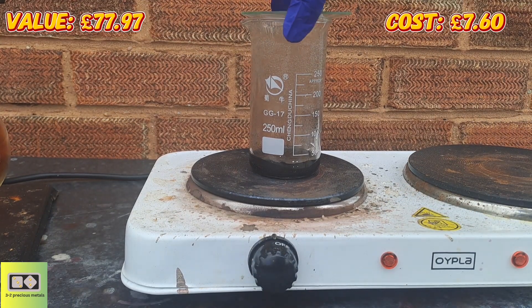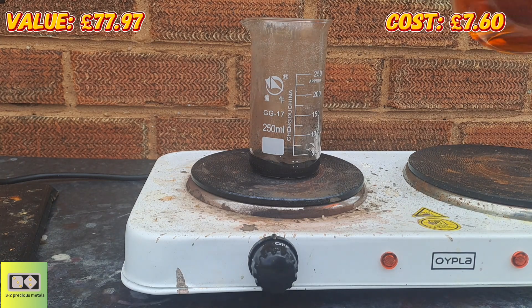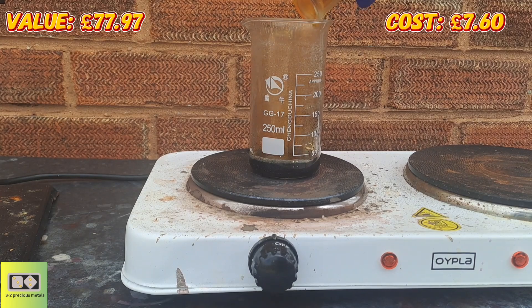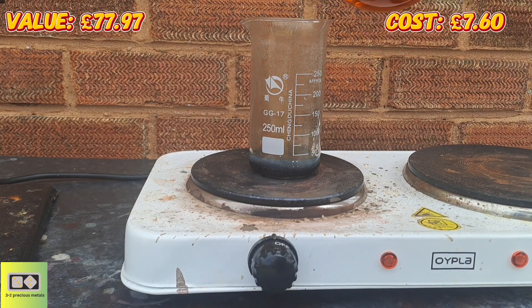I've just done a quick test pan of this material and surprisingly there's a lot of copper in there, which makes it very difficult to pan. So I'm going to give it a quick nitric acid boil to remove some of that copper and then I'll have another go at panning.